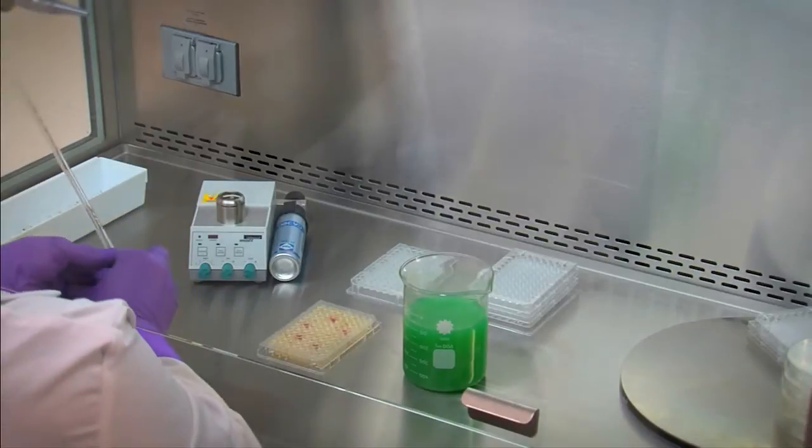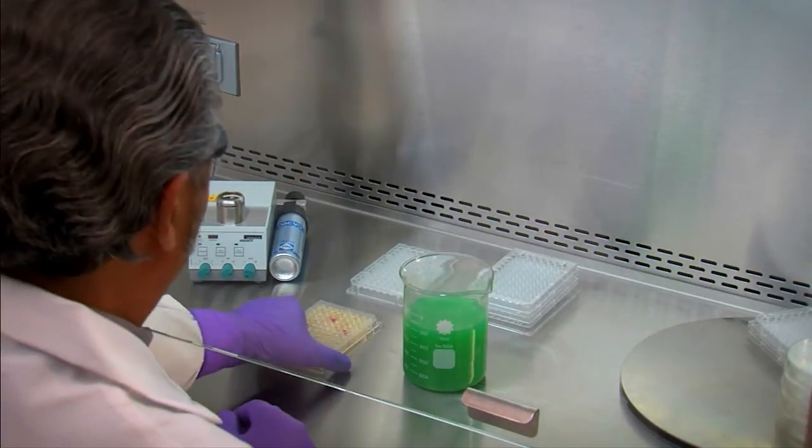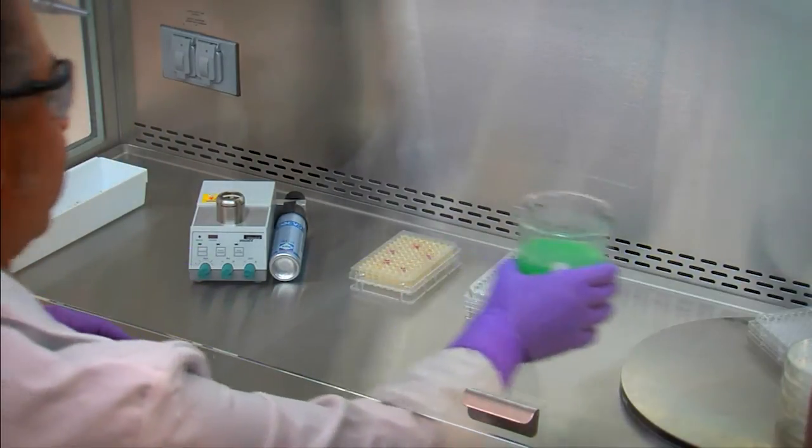The prevention of cross-contamination is imperative when working with sensitive and potentially hazardous material. Opened tubes or bottles should not be held in a vertical position.